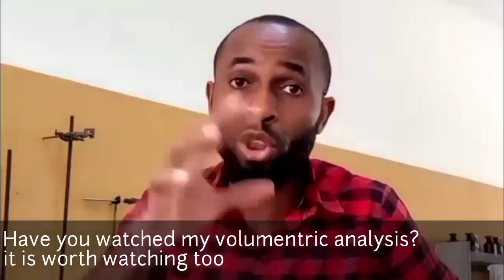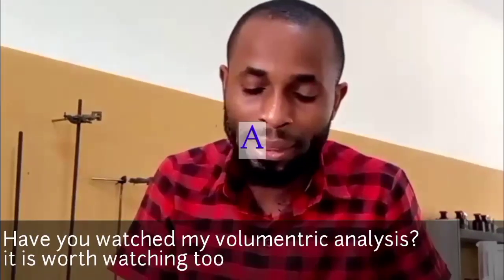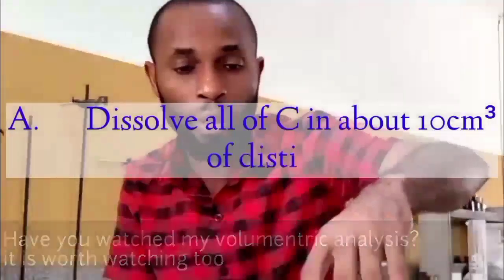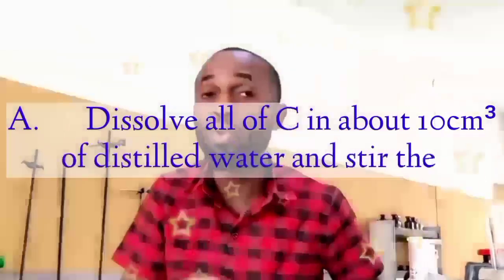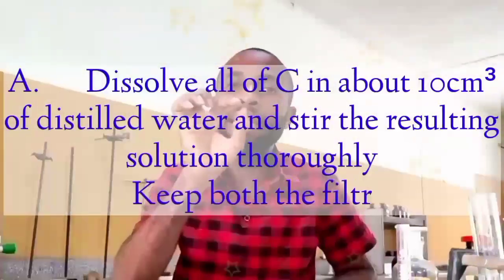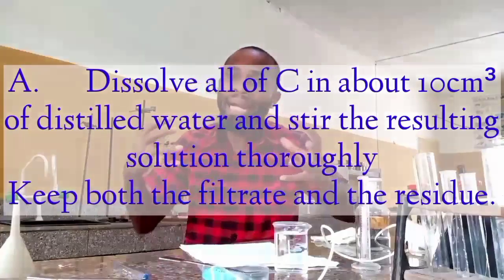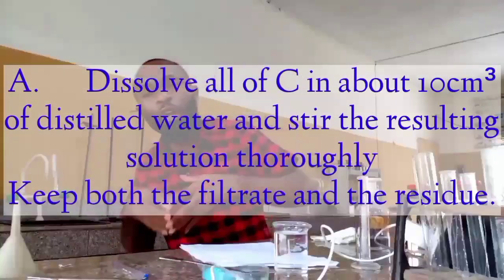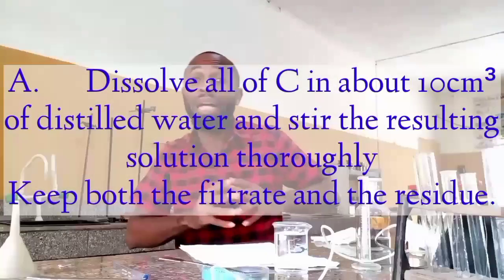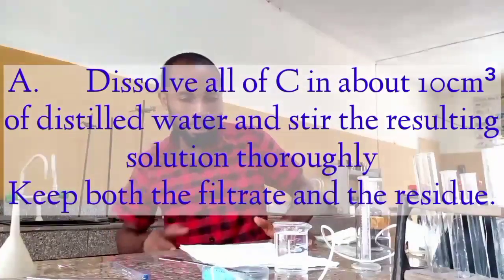The next command they are going to give you, according to what I have here, is: dissolve all of C in about 10 cubic centimeters of distilled water. Okay, this is my distilled water here. Stir the resulting solution thoroughly. Keep both the filtrate and the residue. This tells you that they know that the salt, when dissolved in water, we are going to have a filtrate and also a residue. What we mean by that is that we're going to have a solution and one insoluble. That is what they mean by this statement.